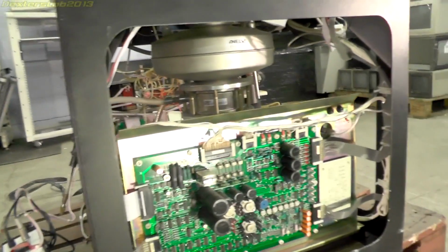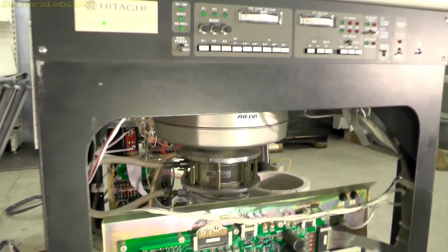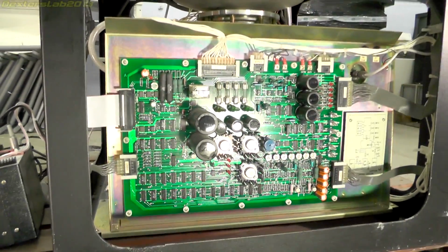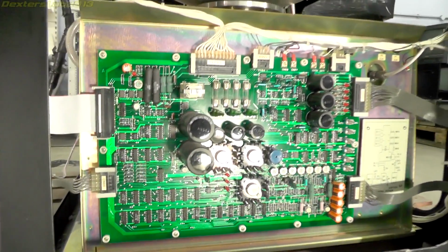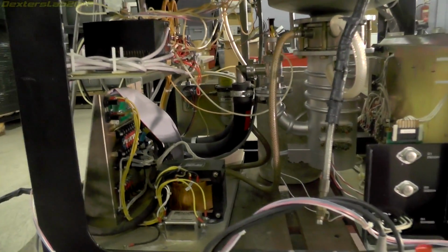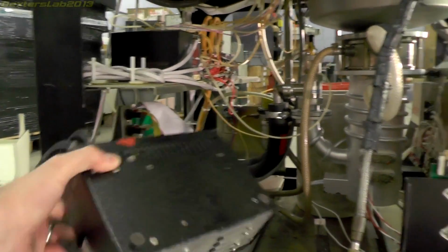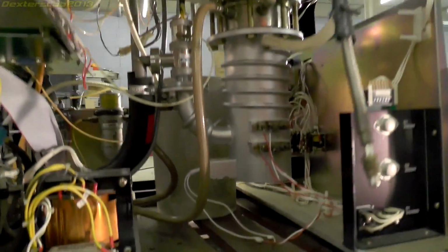Okay, I'm just going to go handheld for this bit. We'll have a look in the base of this main unit. So we have a circuit board there. We'll look at that in a bit more detail later. Around the side, we can start to see a bit more detail inside here. This box was just laying in the middle of everything. It wasn't secured to anything. Not entirely sure what that is for. We should find out in the future.